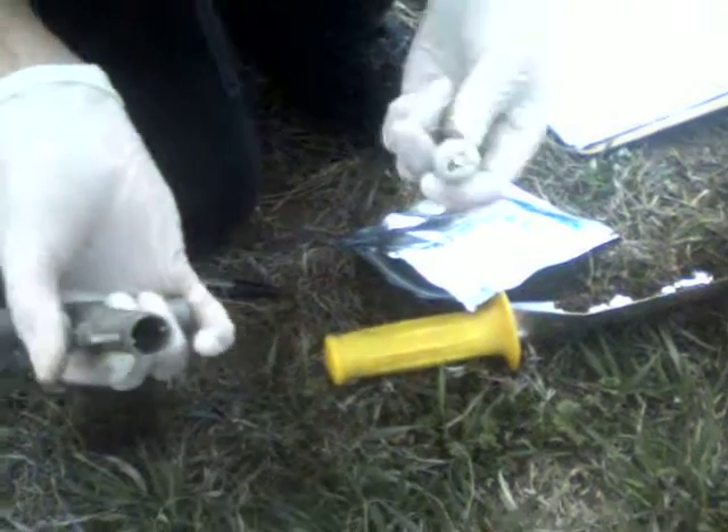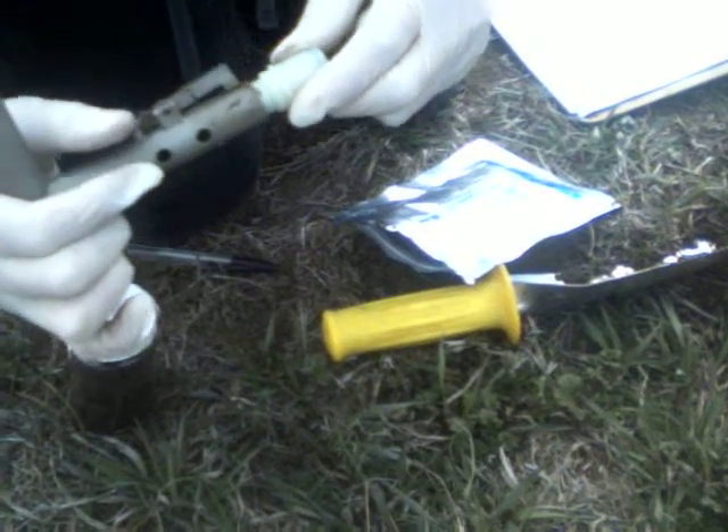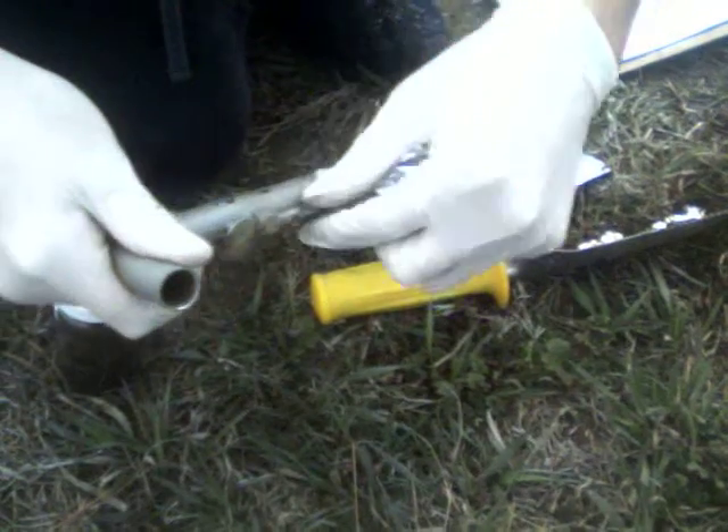There are like two little notches in there. Right. And there are notches in here. So they match up. And then you lock it in by twisting it. And this keeps it in too.